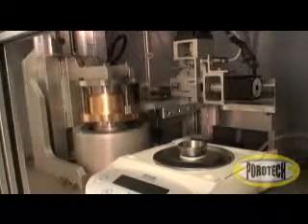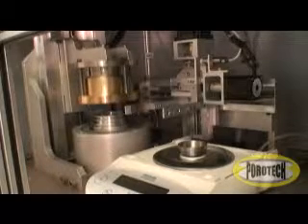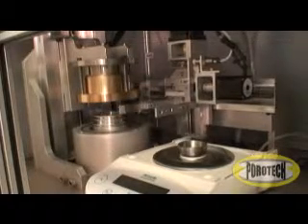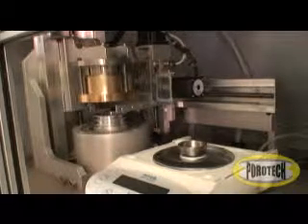When the drying time of the first step is over, the chamber opens. Now, the stack is transferred back to the balance and each cup is weighed individually.